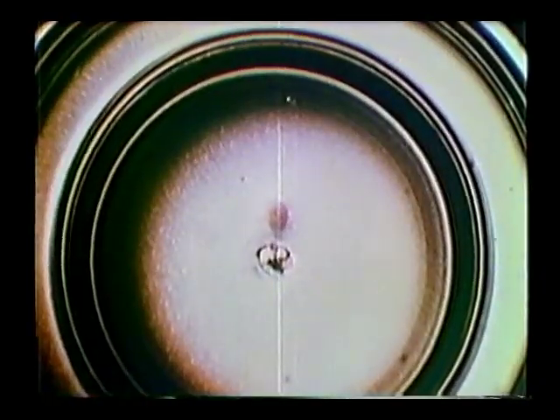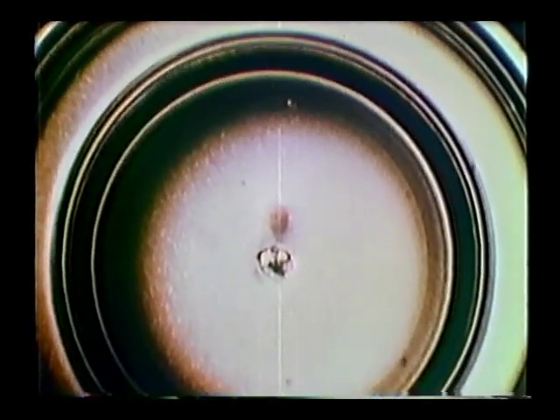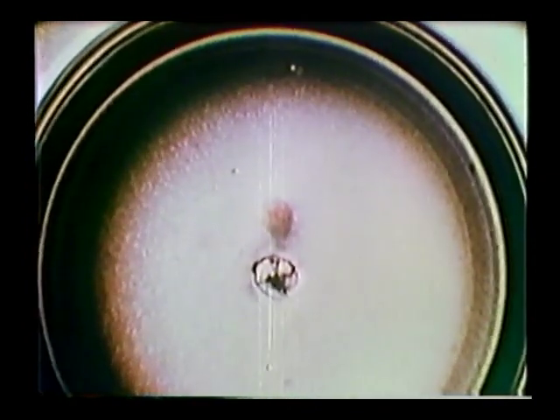The free otocyst is further dissected to remove the adherent mesenchyme and rhombencephalon. The isolated otocyst is placed in the previously prepared organ culture dish which contains the warmed organ culture media. The dish containing the otocyst is closed and returned to the incubator. The otocyst remains in the dish for 5 to 10 days to undergo the extracorporal growth of the inner ear.